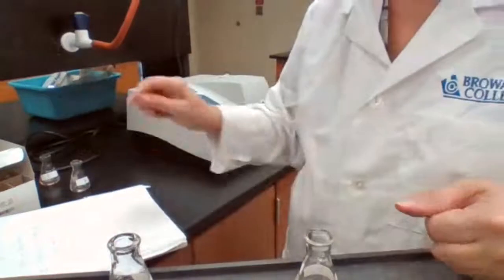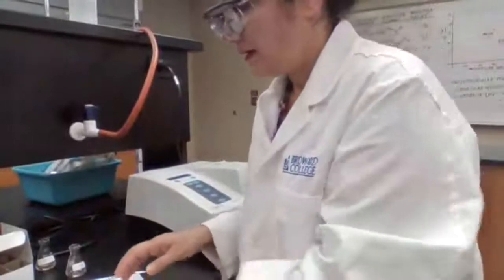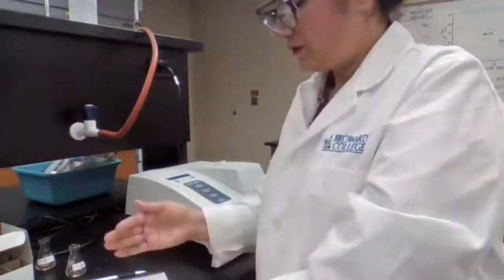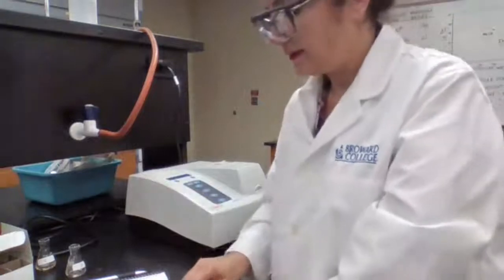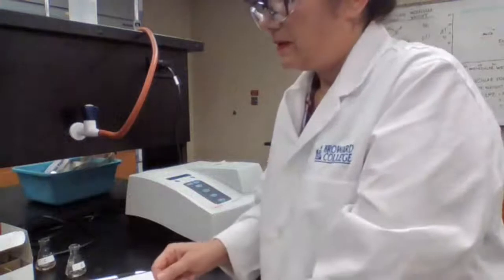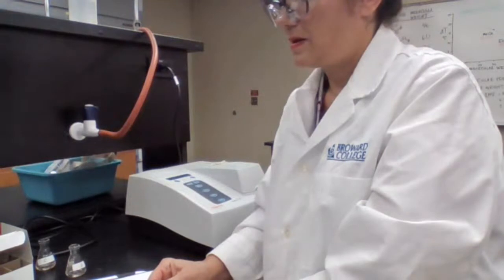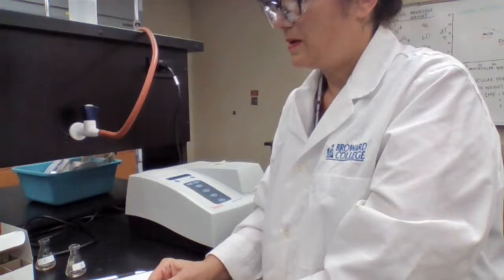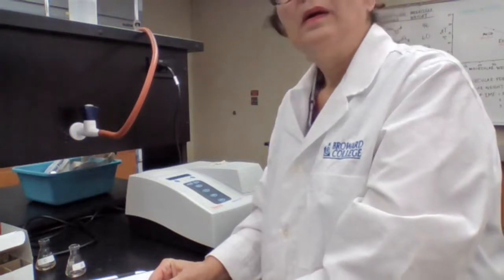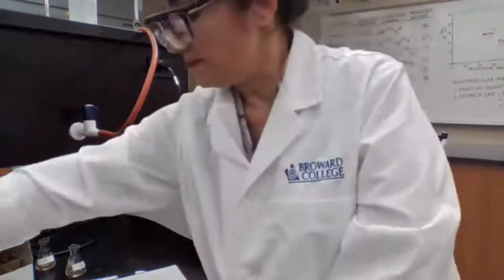Okay. My sample D is going in at 2:07. So I just have to wait now because I don't have other standards. I'm just going to look further to see what else I need to do. 2:07 D is going in.